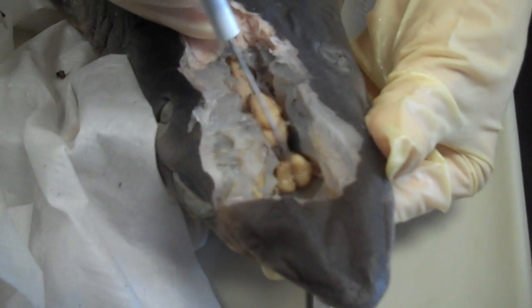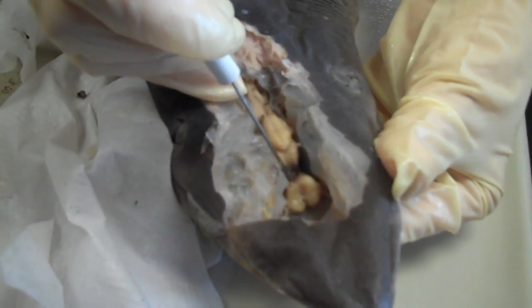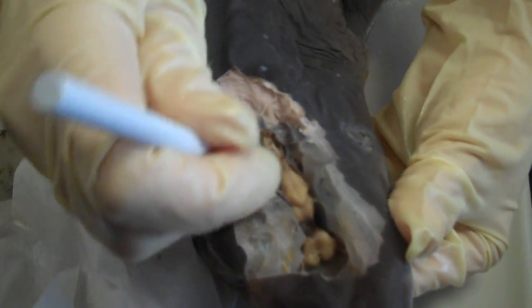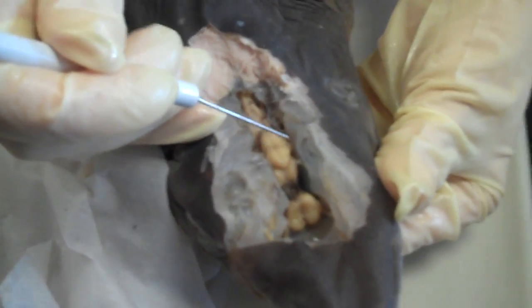Just on top of that, this area right here is the cerebral hemisphere. This darker indentation here is the diencephalon. These two bulges are the optic lobes, and this oval part is the cerebellum. And then these two long branches that come together like a Y would be the medulla oblongata.